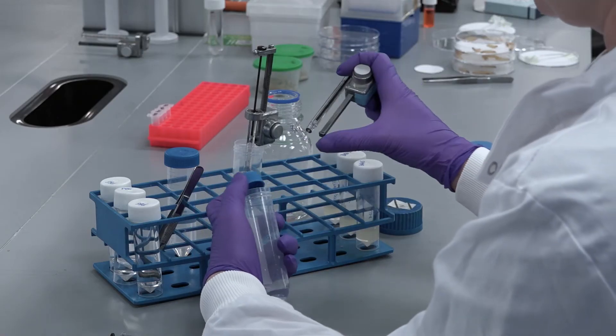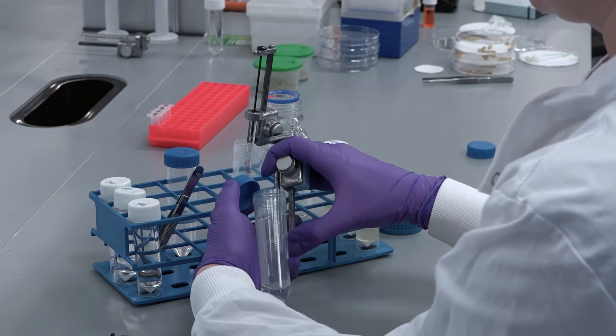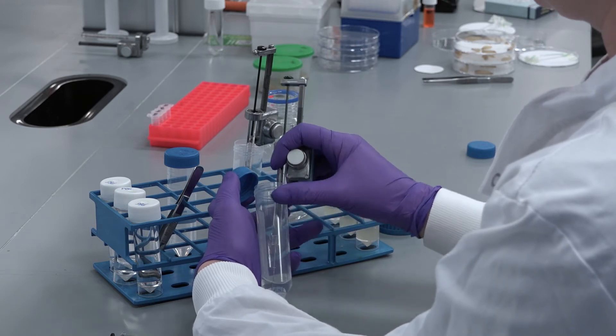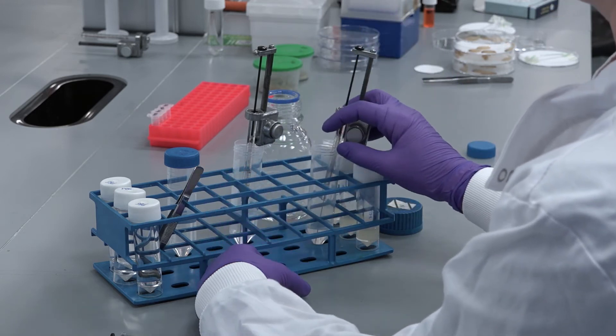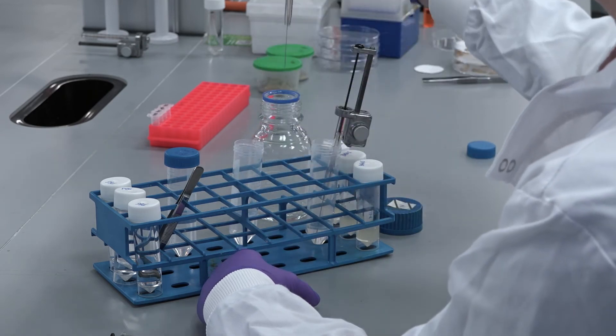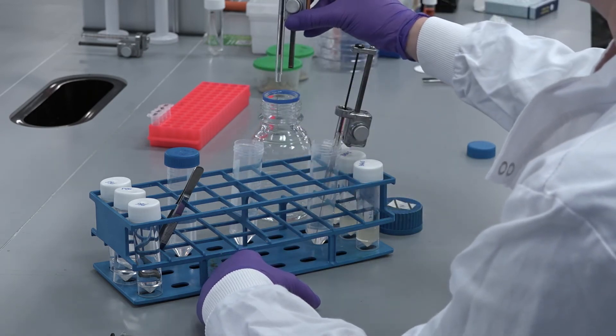After use ensure the needle has been thoroughly decontaminated and rinsed. Disposable needles are also available.